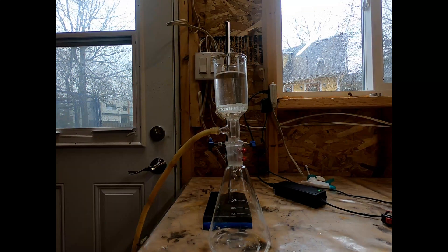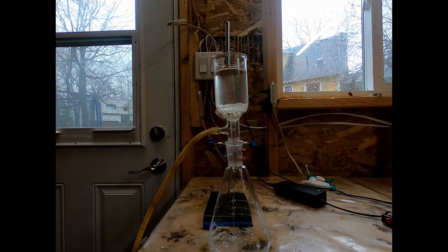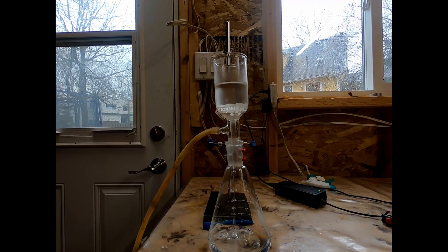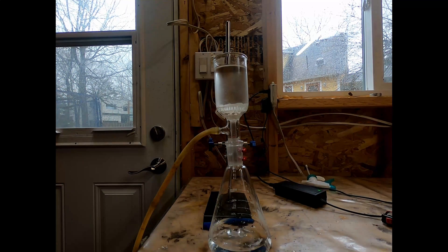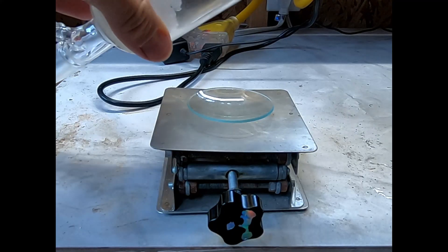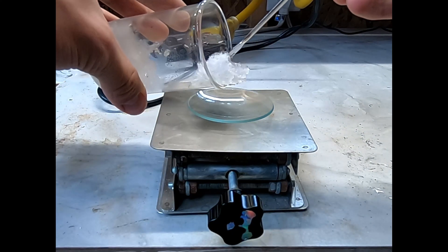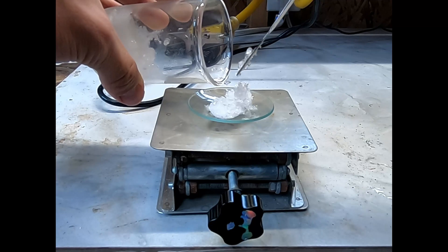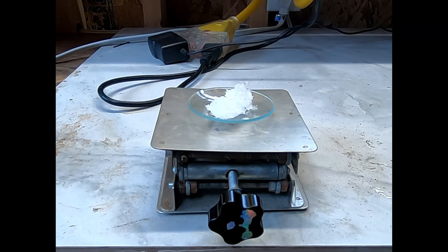I then proceed to separate the crystals from the solution by vacuum filtration. This is kind of slow, but at the end we're left with a nice yield of fluffy pure sodium carbonate crystals. These are still kind of wet, but at the time I didn't have a vacuum desiccator, so I didn't really have a choice and just left them wet.